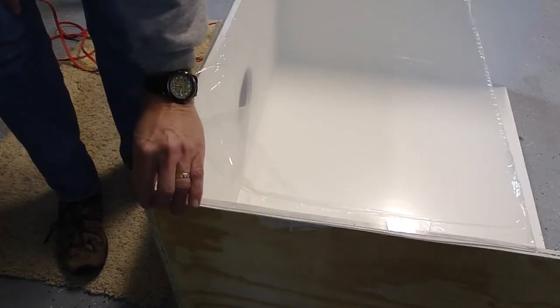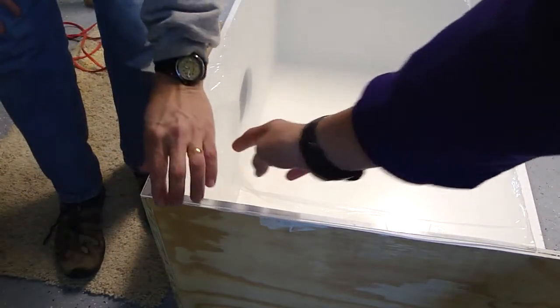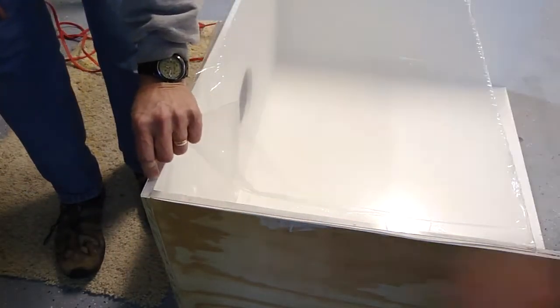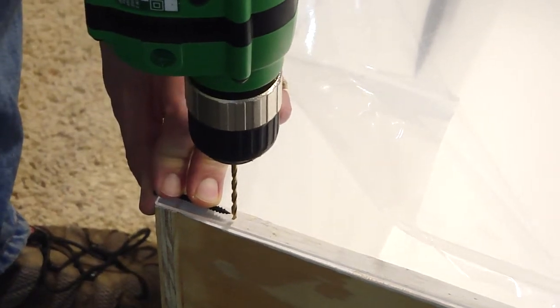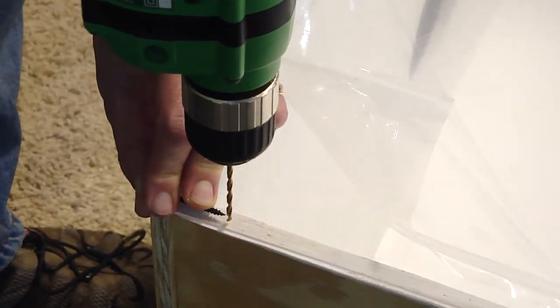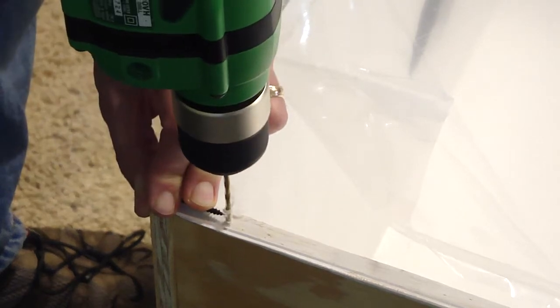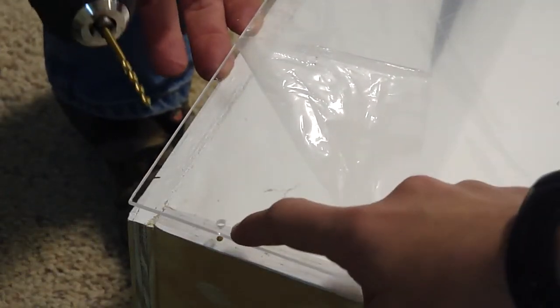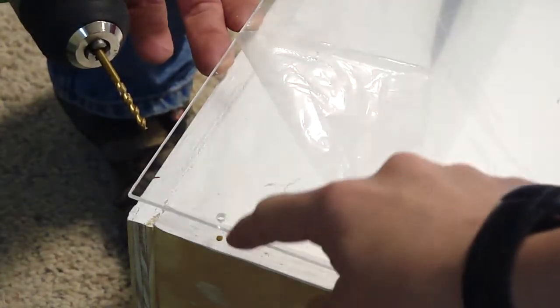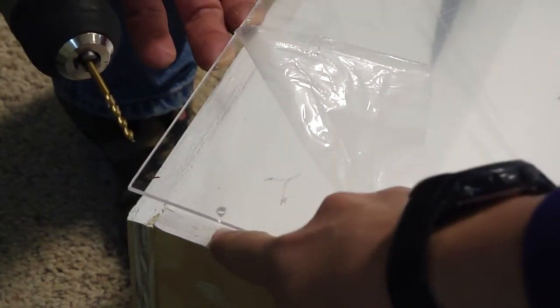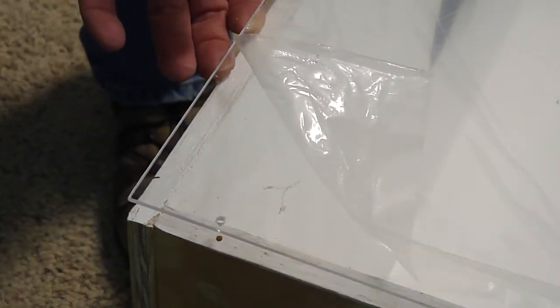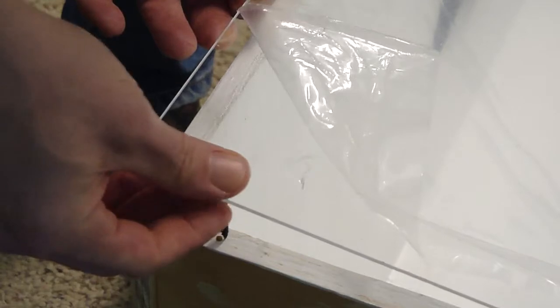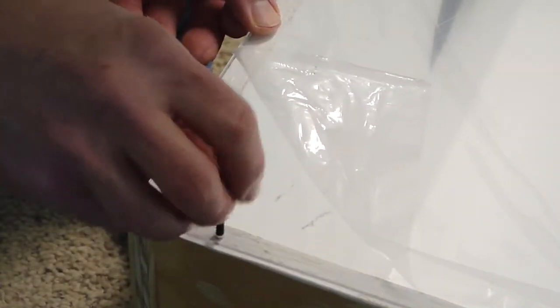We took off the back layer of the protective plastic since we're going to screw it down, and once we get all the screws in, we're going to take off the top layers. We have the screw placed there so we can see where the screw that's holding this wooden place is so we know not to drill into it. We decided to use a bigger drill bit for the plexiglass, but the smaller drill bit for the wood so that it can go in without cracking the plexiglass. But it will have to screw into the wood.